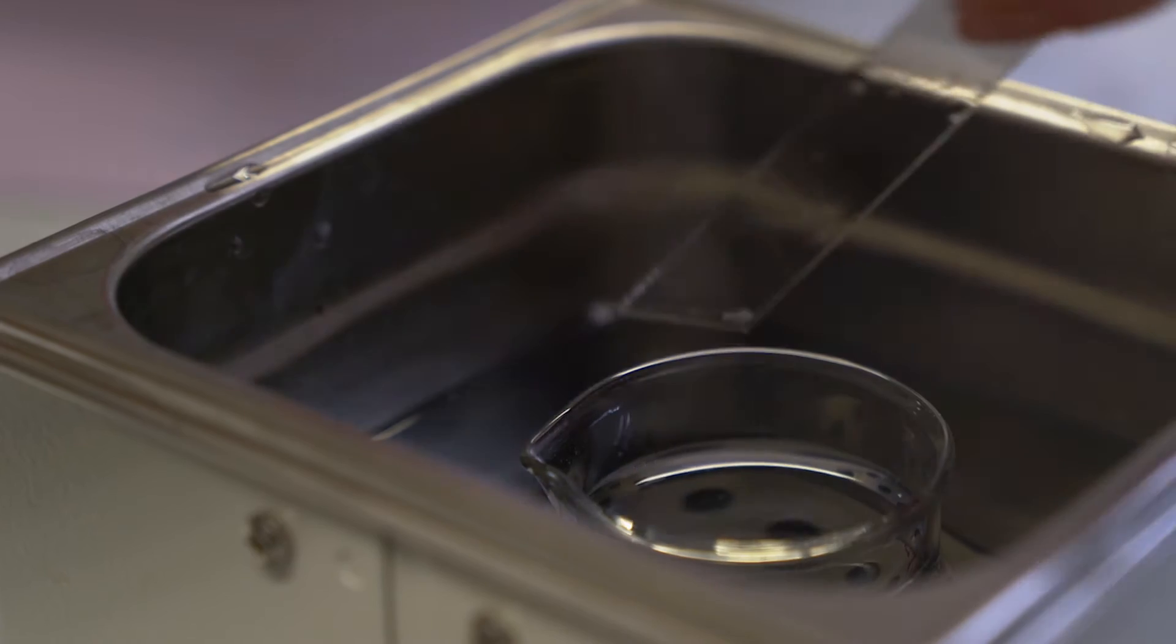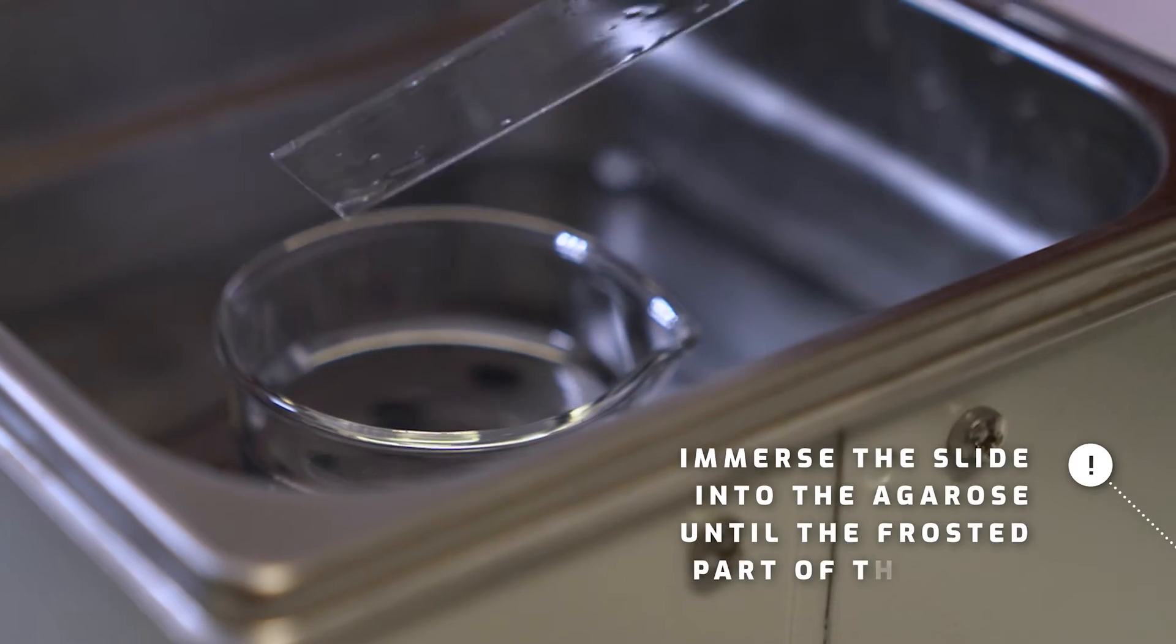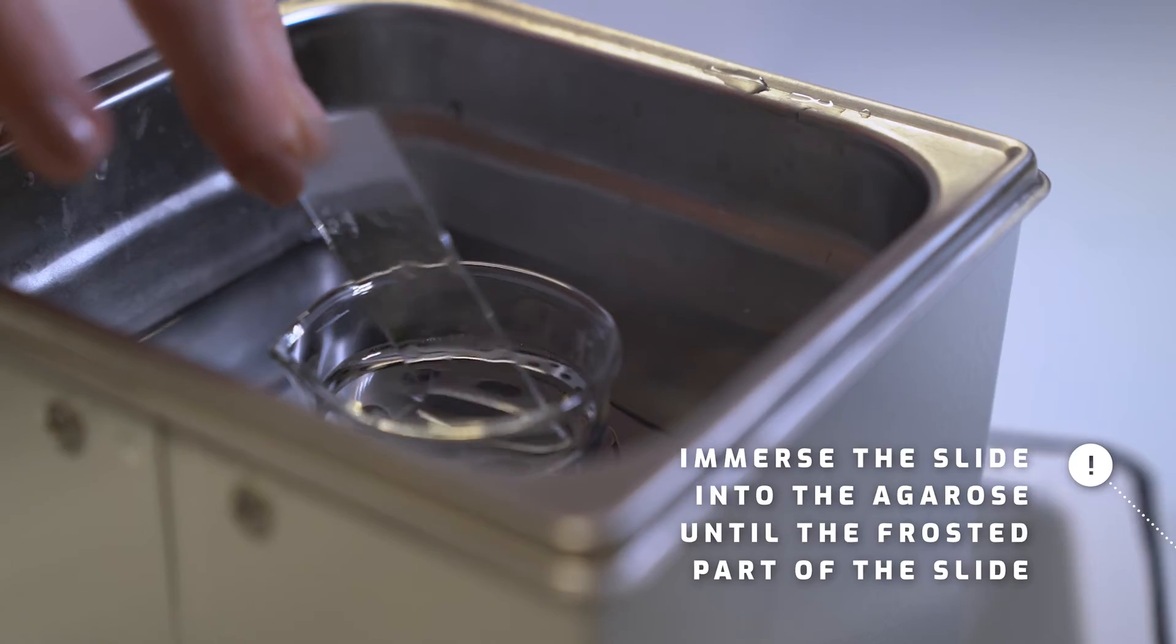When dipping, you have to immerse the slide on the agarose until the frosted part of the slide.